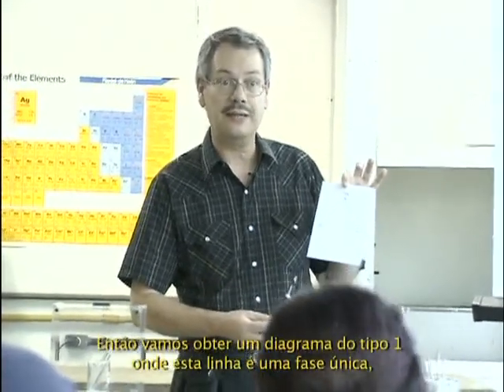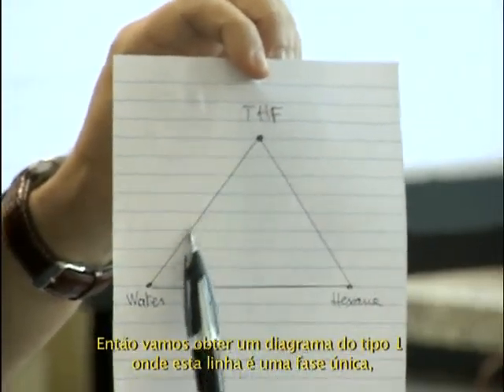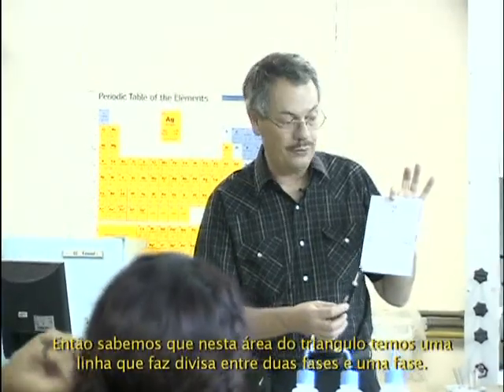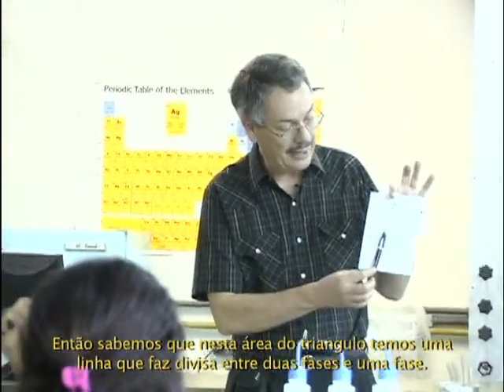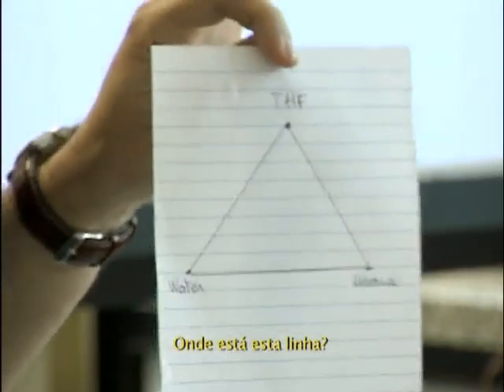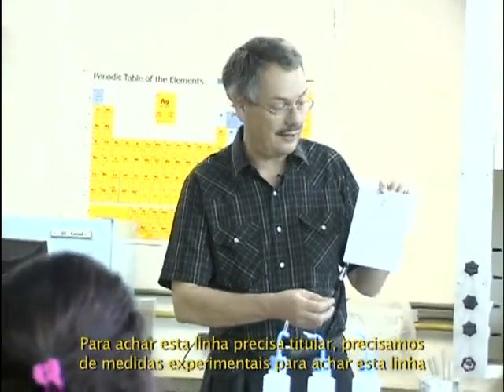So we will obtain a type 1 diagram, which means this is a single phase, we are sure. This line is a single phase, we are sure also. And that line is two phases. We are also sure before starting. So we know that in this triangle area, we have some line that will make a boundary between two phases and one phase. Where is that line? To find that line, we need titration. We need experimental measurement to find that line.